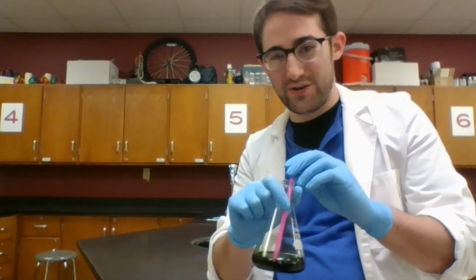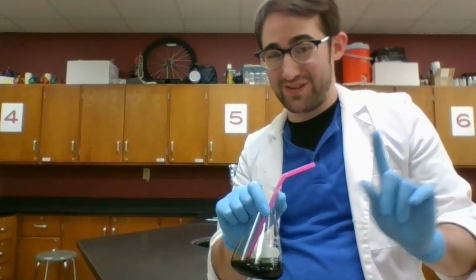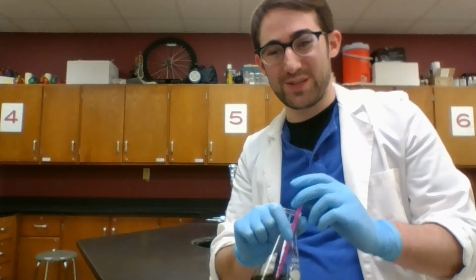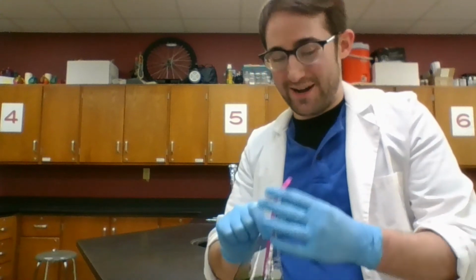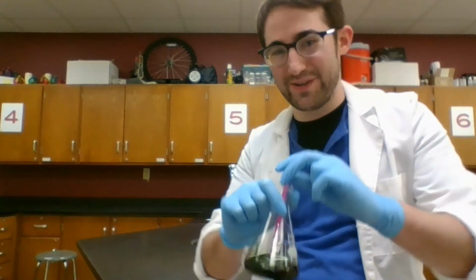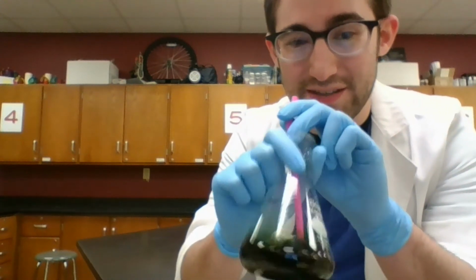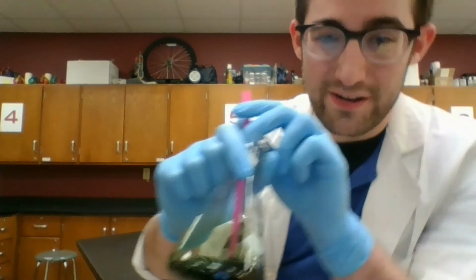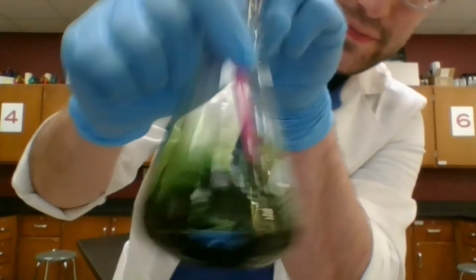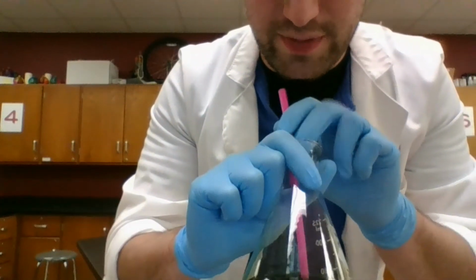To show you an example of this, I'm going to blow bubbles into this, which again, you should not do unless you are a licensed professional or someone has specifically told you it's okay. So do better than me. I also wear goggles during this, but here we are living dangerously. As you can see, we're starting off with a very dark green color. I can get a little bit closer here. Dark green color. So let me start blowing bubbles into this.